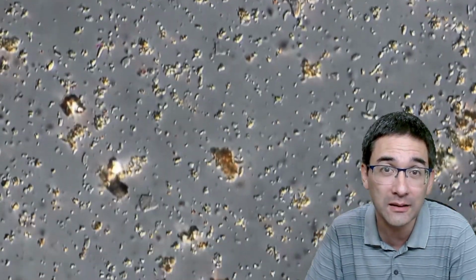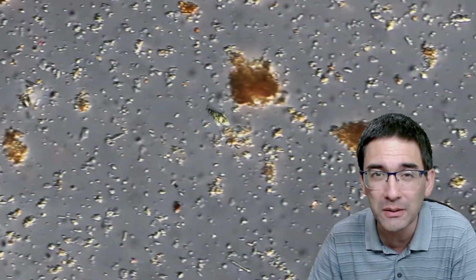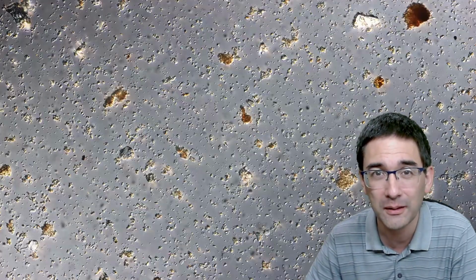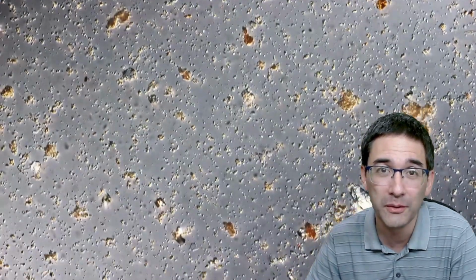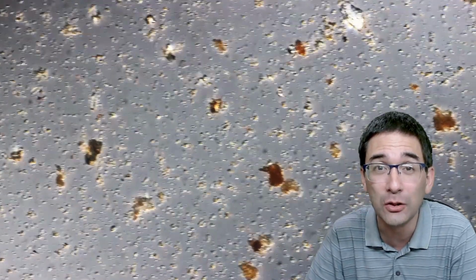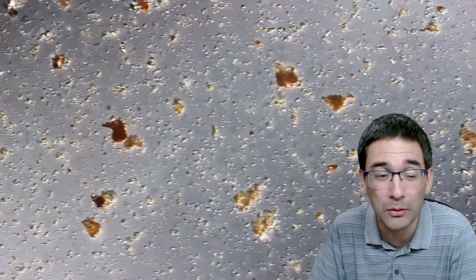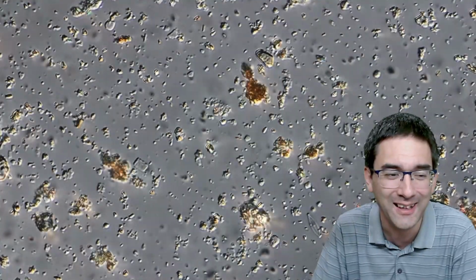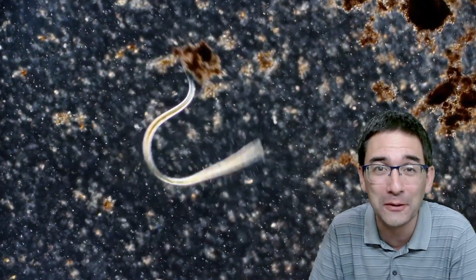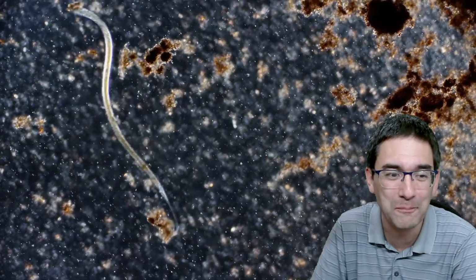This means that there was maybe not enough organic material. Well, there was lots of decomposing material around there, but there were not so many photosynthesizing plants and algae. So the only organisms that I expect to find there are essentially those that break down decomposing wood. But because of the rain, I suppose that all of these things have already been washed away. I'm hypothesizing, okay? This is the nematode. That was the only one that I actually found in the sample. We've seen nematodes quite often already.